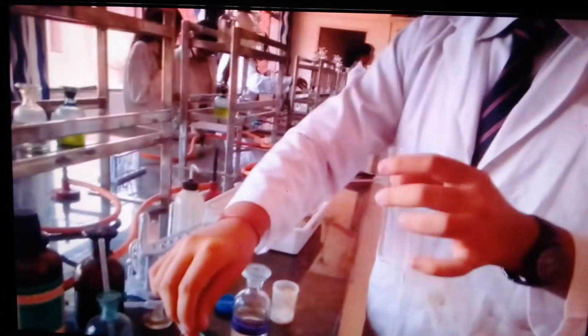Discard the contents of the test tube, wash your test tube, and move to the second lot of anions by taking a fresh pinch of salt. He's taken a fresh test tube also. That may not be done by you. You can use the same test tube. Again, take a pinch of salt. This time you are to add concentrated sulfuric acid and give a close observation for any evolution of a gas.